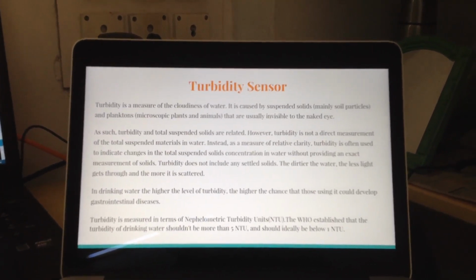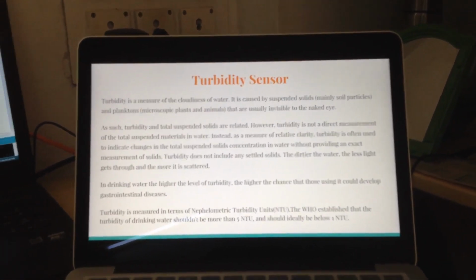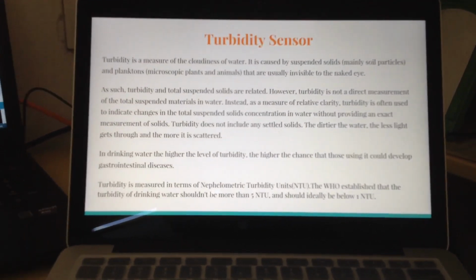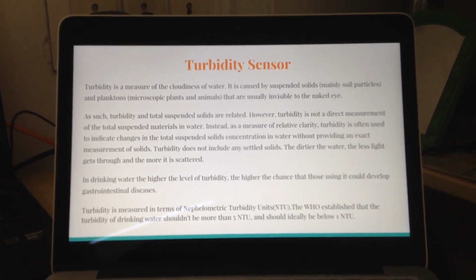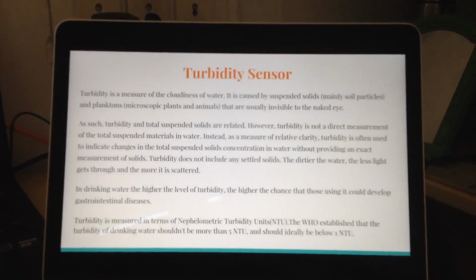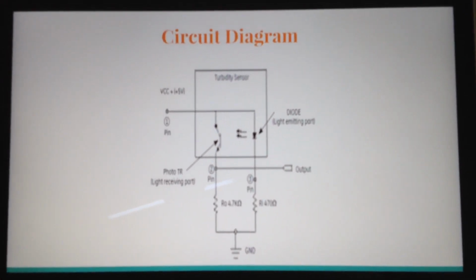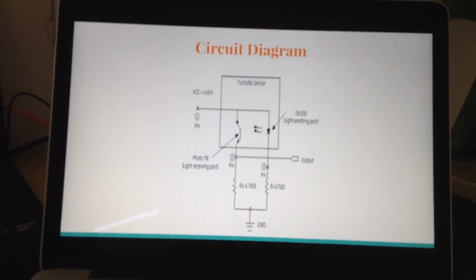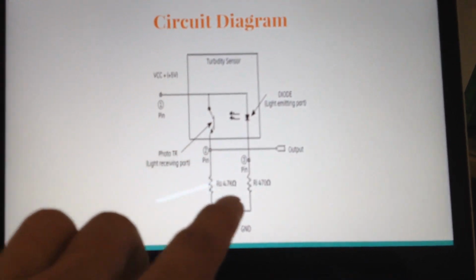So in case of turbidity, turbidity is directly proportional to the scattering of light. If the water is muddy, the particles present in it would scatter more light, and that tells us that the water is cloudier. So the basic circuit is that we have used a light emitting diode which sends a beam of light across the water sample, and this is the receiving port.